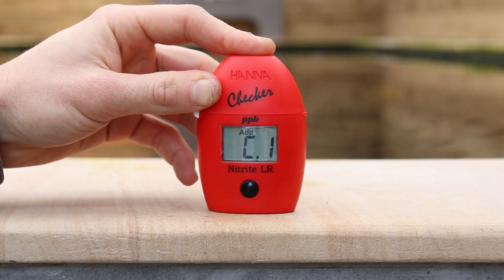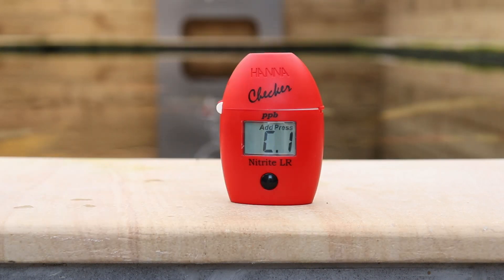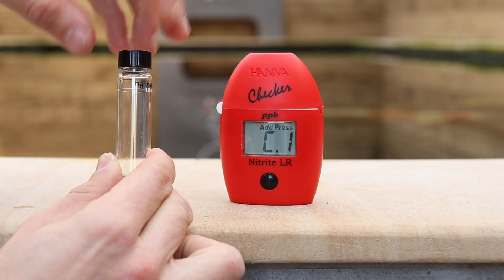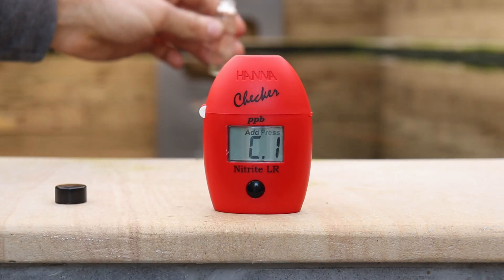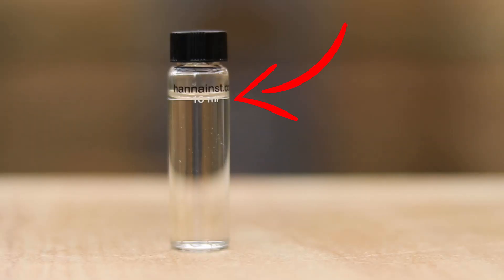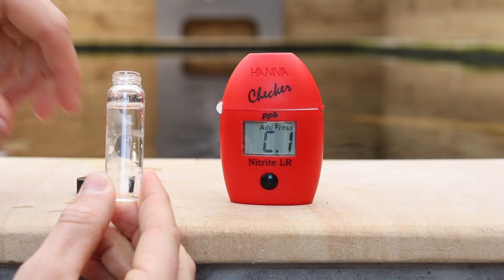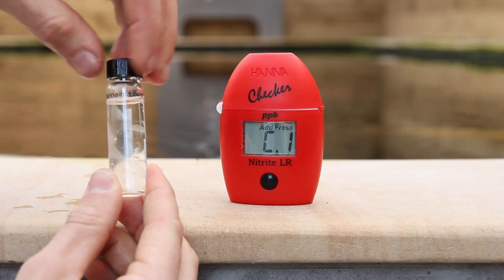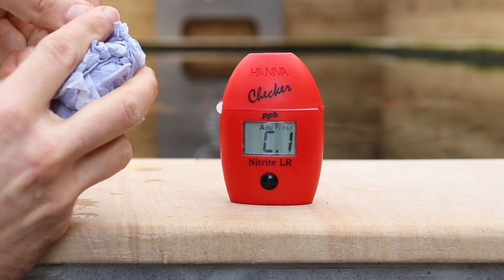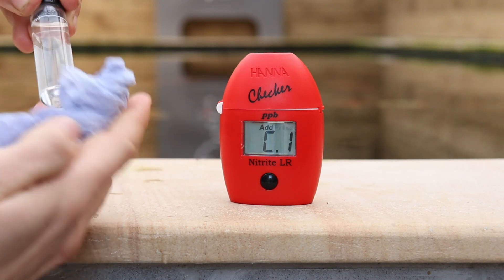You should get C.1 displayed. At this point we need to calibrate the reader. We're going to fill the glass cuvette with some water from the tank. You want to fill the water all the way up to the top of the white line which says 10 ml. Once you've done this you can screw the cap on top of the glass and then with a cloth you need to dry it down to make sure there's no excess water outside, which is going to affect the light reading.